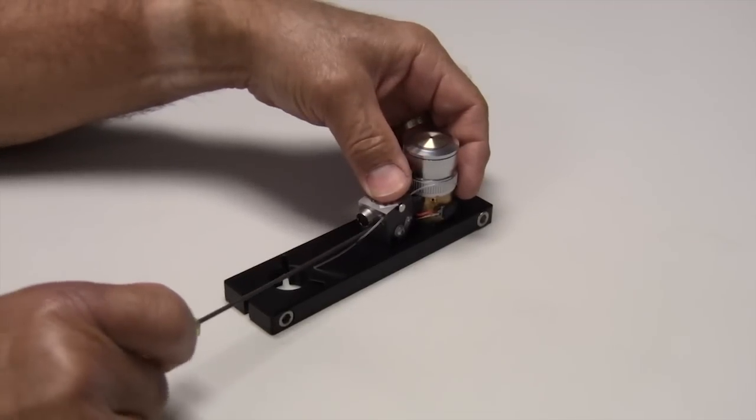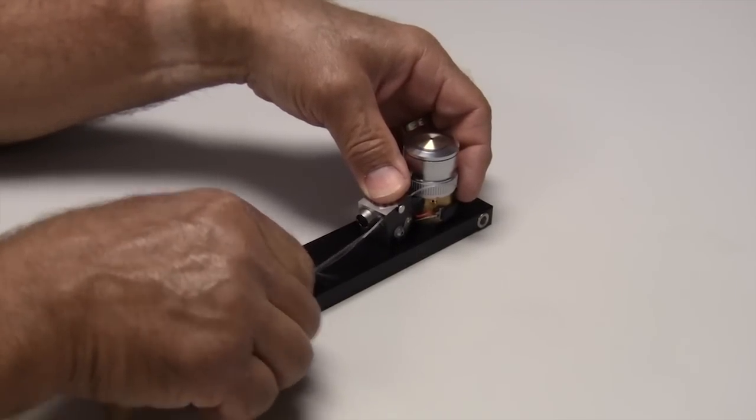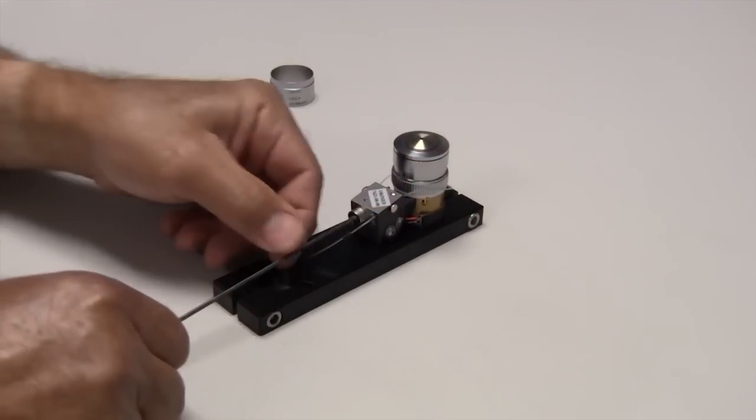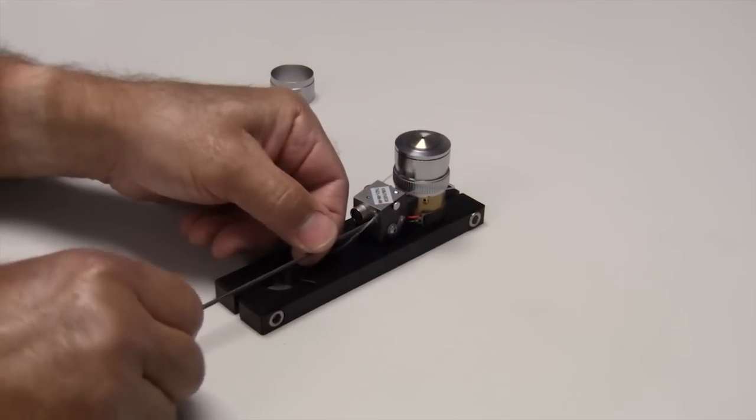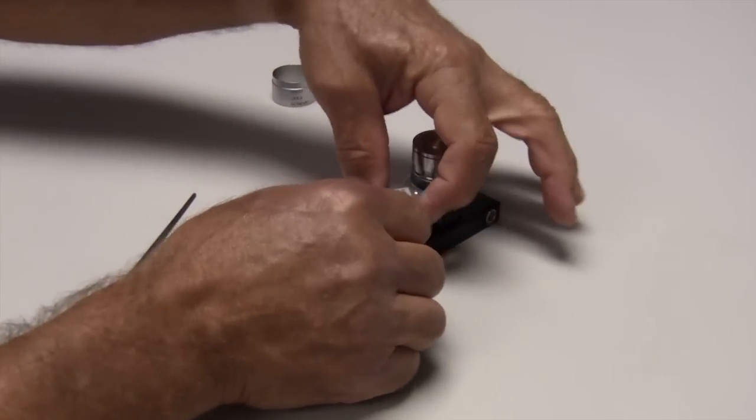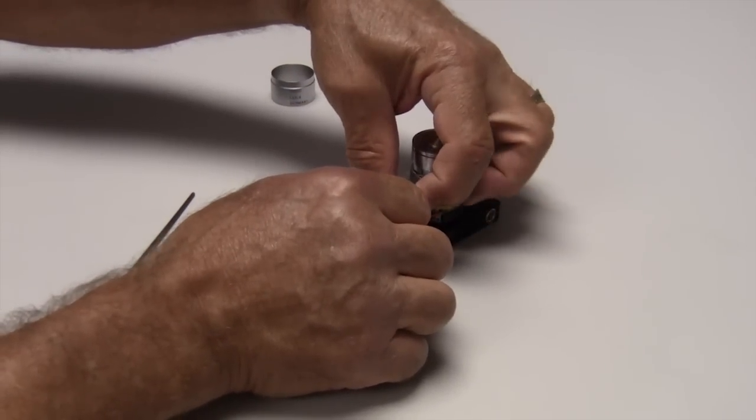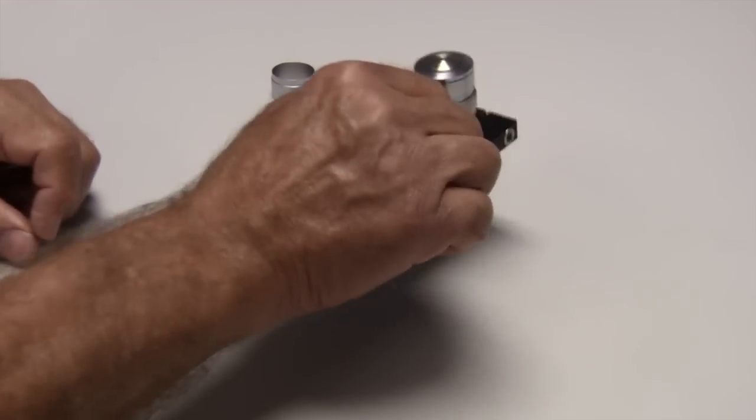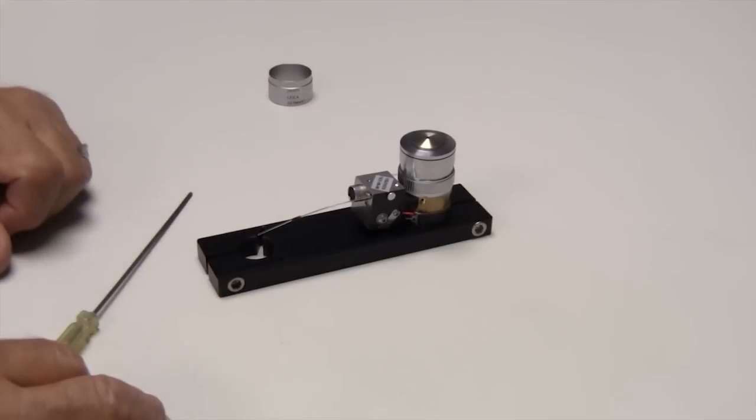You put your screwdriver into the little slot in the back, rotate it until it feels just a little bit snug, then squeeze the button on the side and pull the connection strap snug. So now the objective heater is solid to the objective.